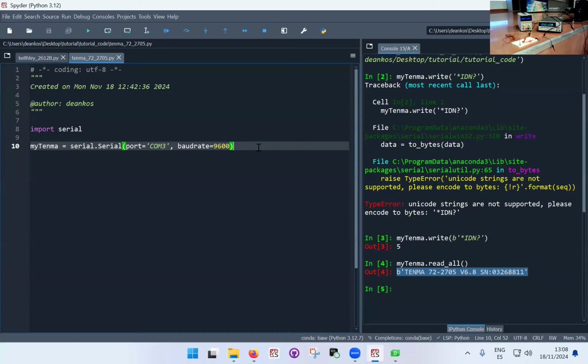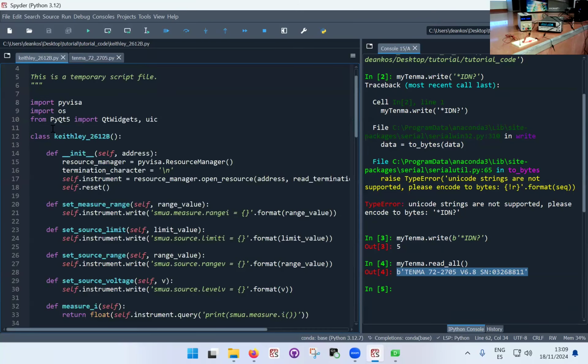But I would say with the libraries, all I'm using here is literally what you can see at the top of these scripts. So yes, Anaconda, once you install it, it's a few gigabytes of data. Do I use it all? Absolutely not. I use a few. I use definitely the serial library. I use the Visa library. I use the OS library, NumPy, which is sort of universal for mathematical operations, and really not many more. The PyQt and the PyQtGraph, which we're going to use.